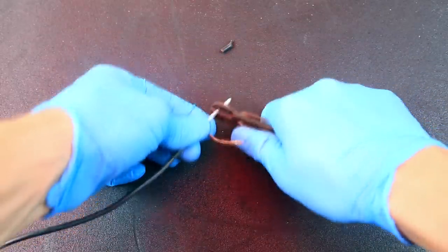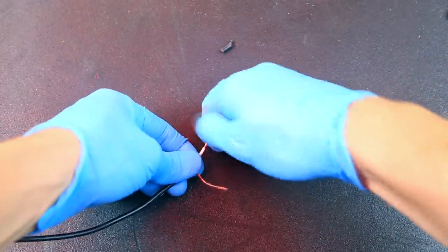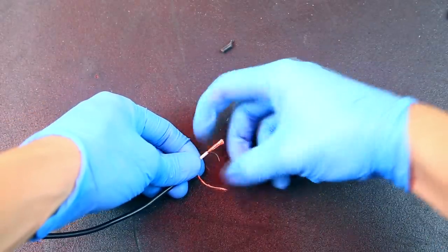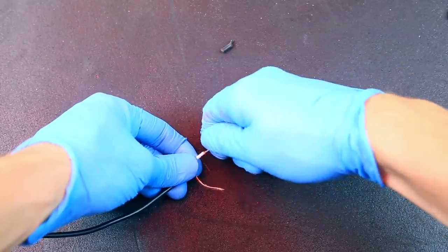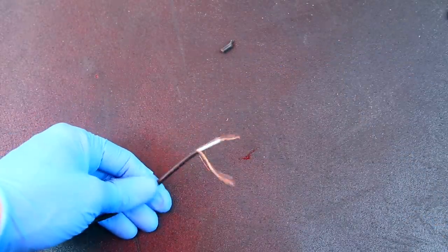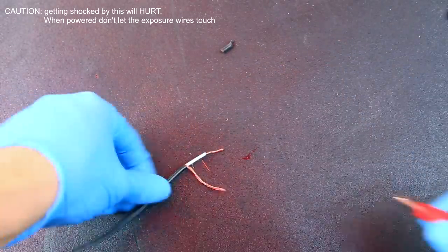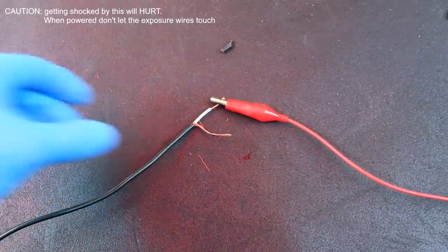Then with the white wire free, a little bit of it was stripped to expose the inner wire which is the positive. So now these are going to serve as our positive and negative terminals instead of the battery. And then just like before we attach an alligator clip to each of the terminals.